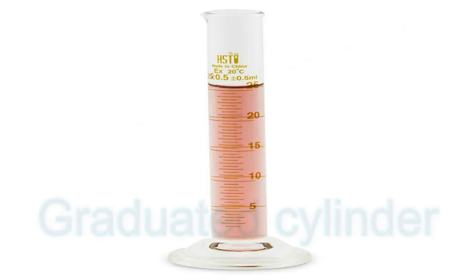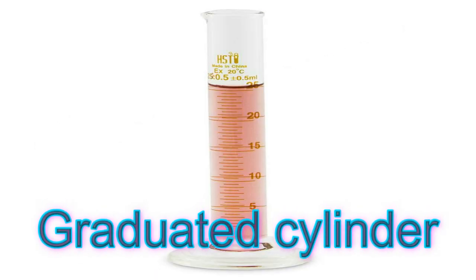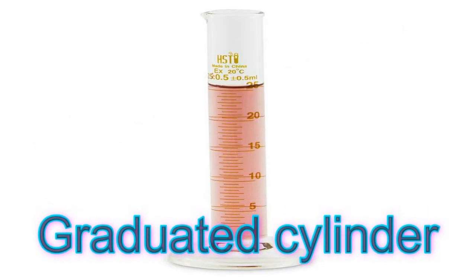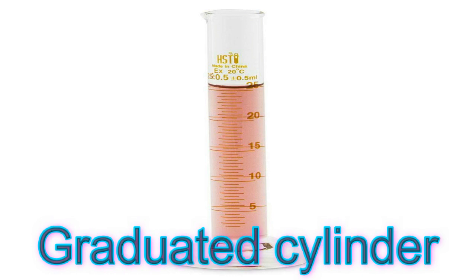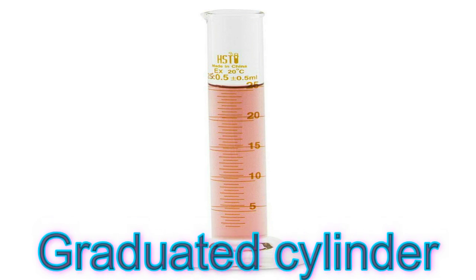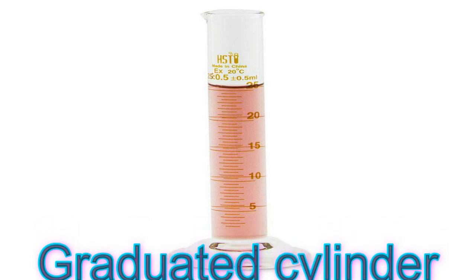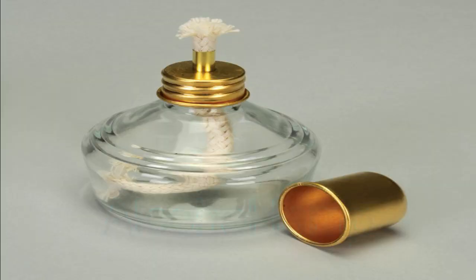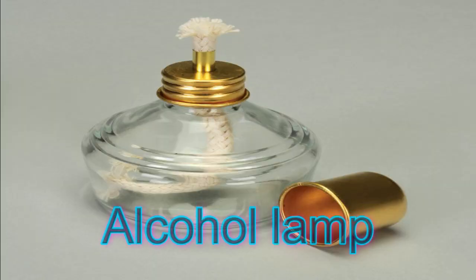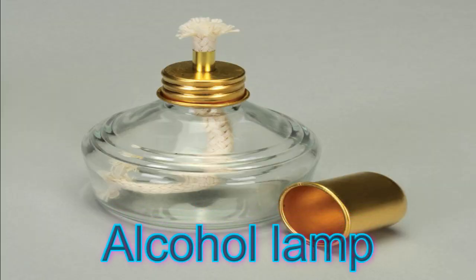A graduated cylinder is used for measuring the volume of liquids like water, oil, and other solutions. An alcohol lamp is used for heating materials.